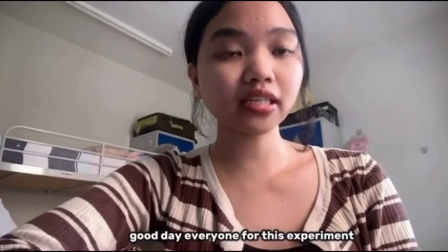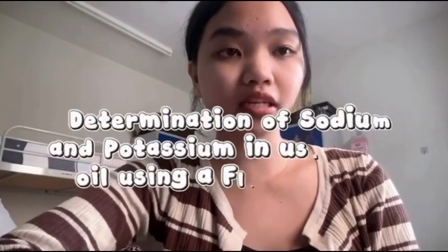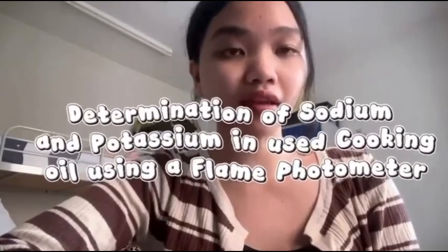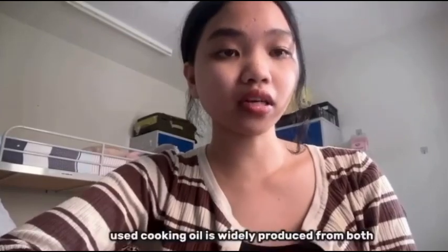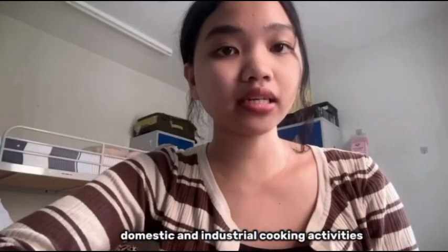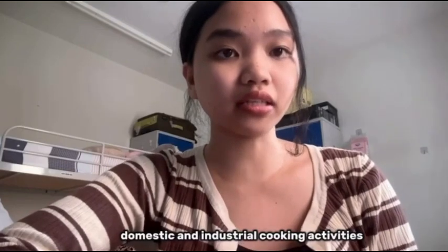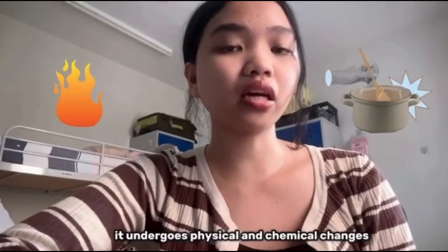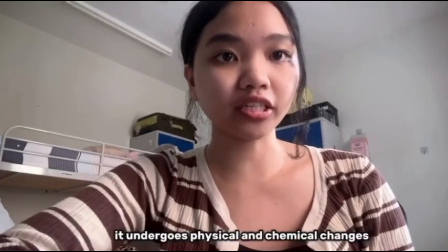Good day everyone. For this experiment, our title is Determination of Sodium and Potassium in Used Cooking Oil using a flame photometer. Used cooking oil is widely produced from both domestic and industrial cooking activities. When cooking oil is repeatedly heated and reused, it undergoes physical and chemical changes.